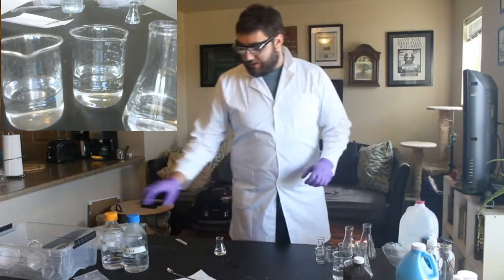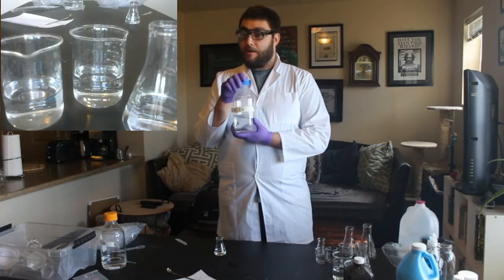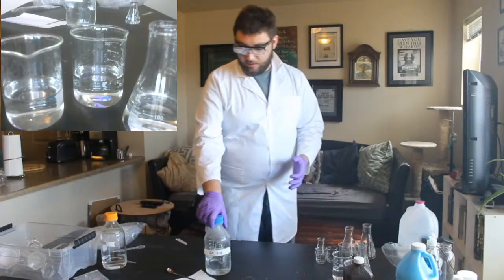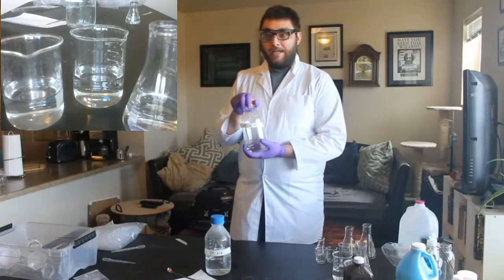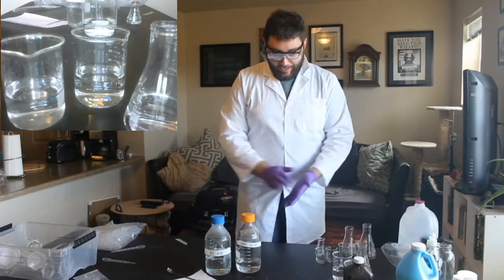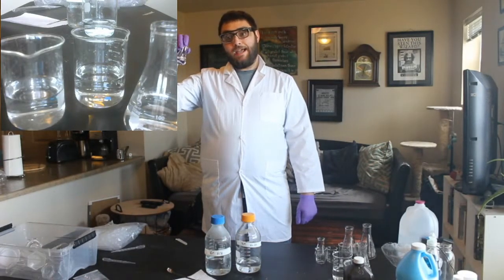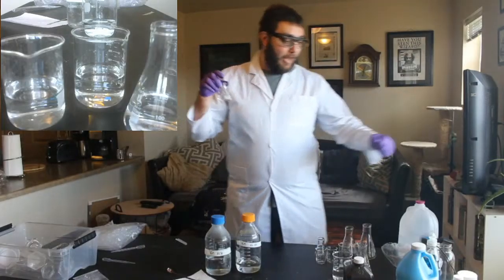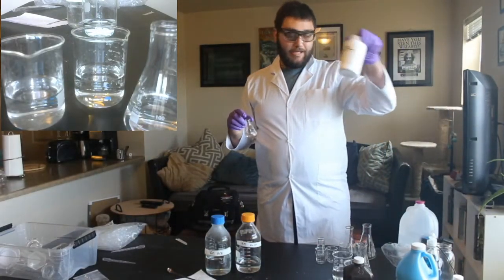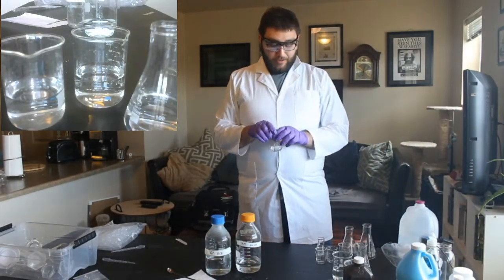So what we're going to be doing is mixing it with an acid, which we talked about last week. It has a low pH. We'll be mixing it with a base, which has a high pH. And then we'll be mixing it with something completely different called potassium iodide. Potassium iodide is normally a crystal. It's a powder, and that's what's in here. But I mixed it up with some water, and it's going to do some really cool stuff.